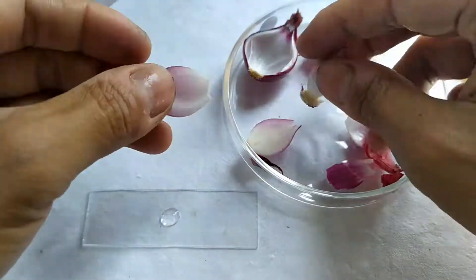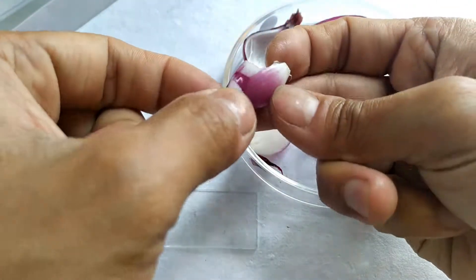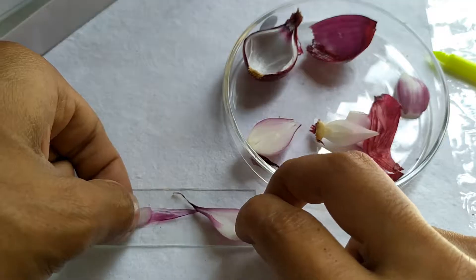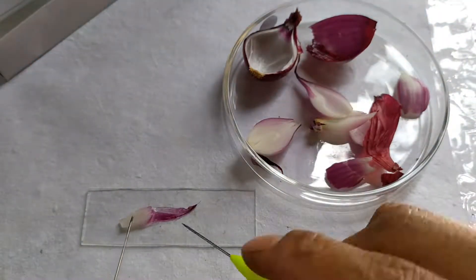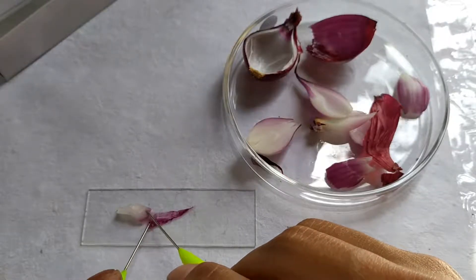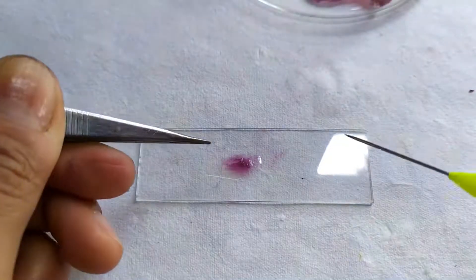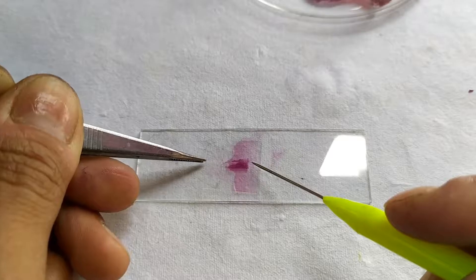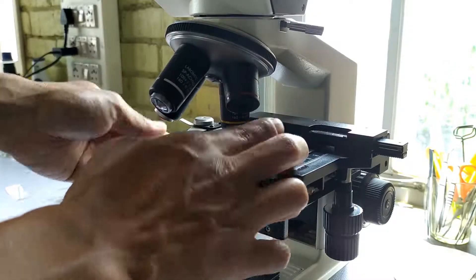To begin the experiment, take an onion bulb and remove a layer of the bulb. Break this layer and peel off the epidermal surface on the colored side of the layer. Place this epidermal peel on a glass slide containing a drop of water. Place a cover slip on the peel.